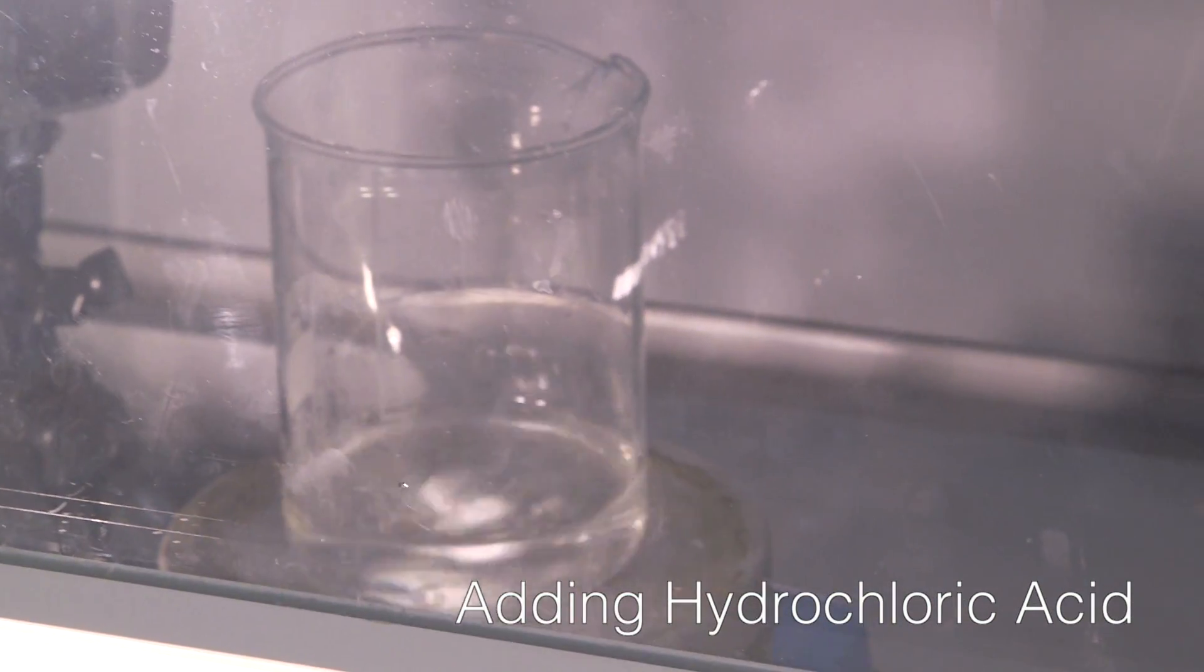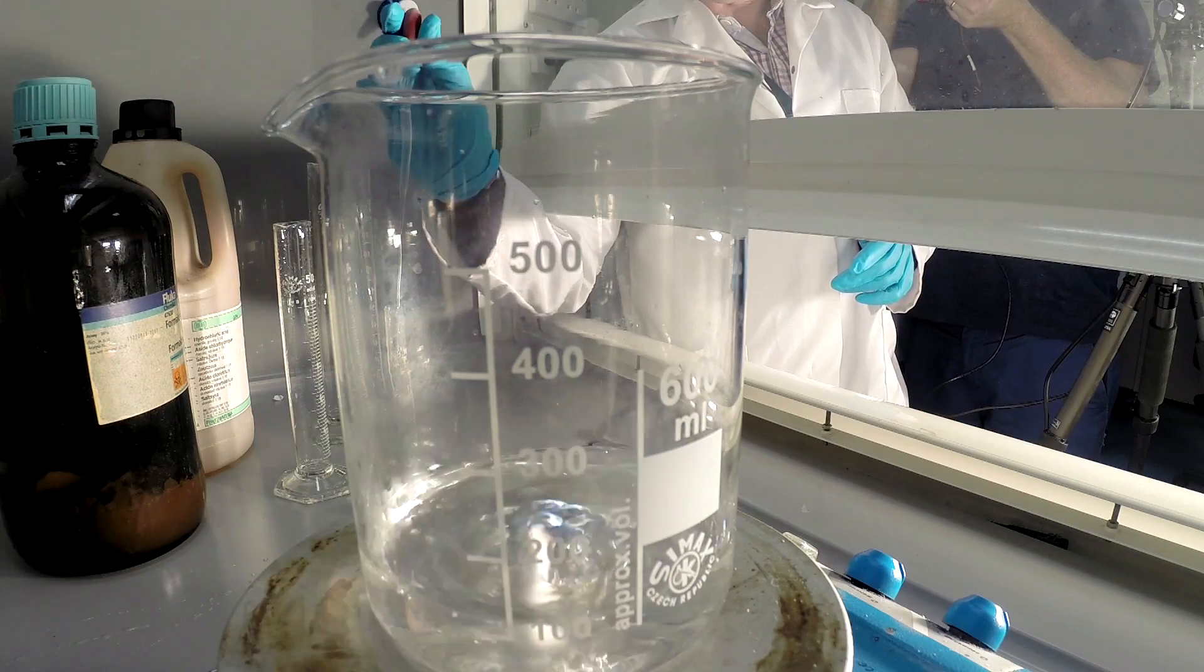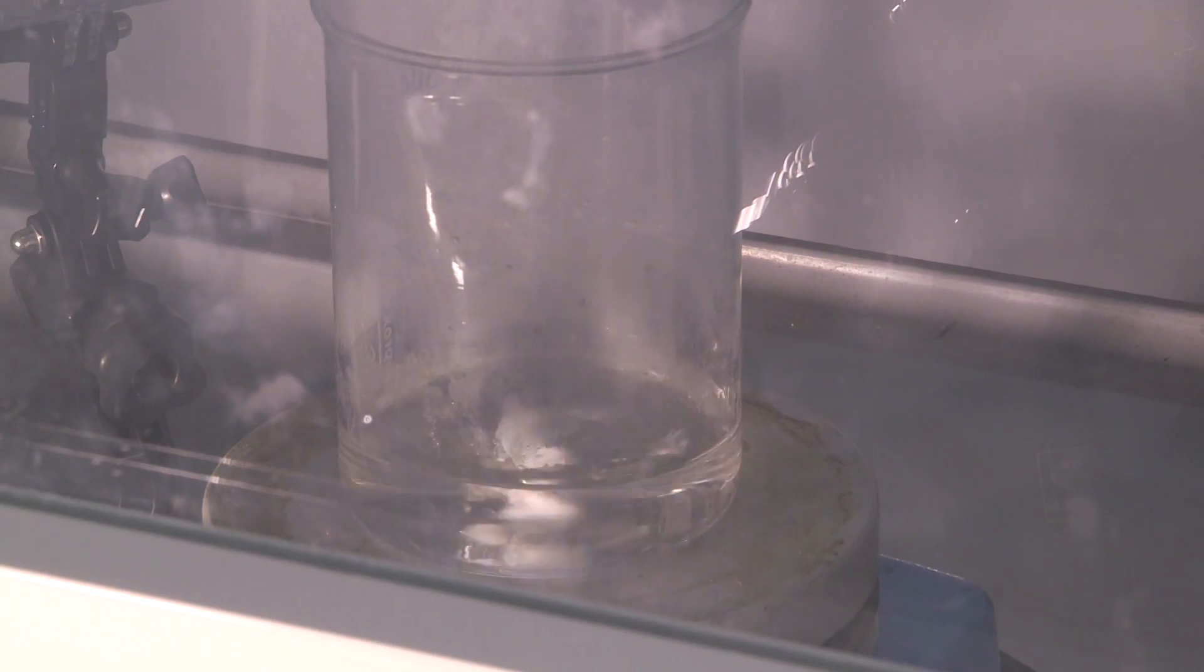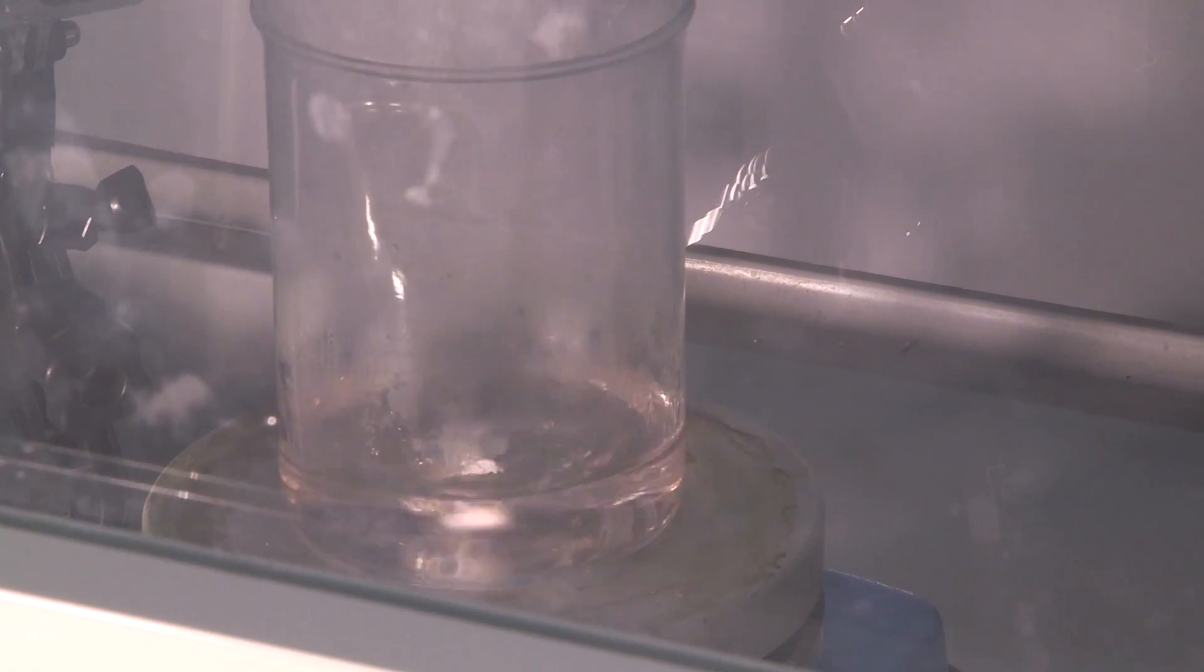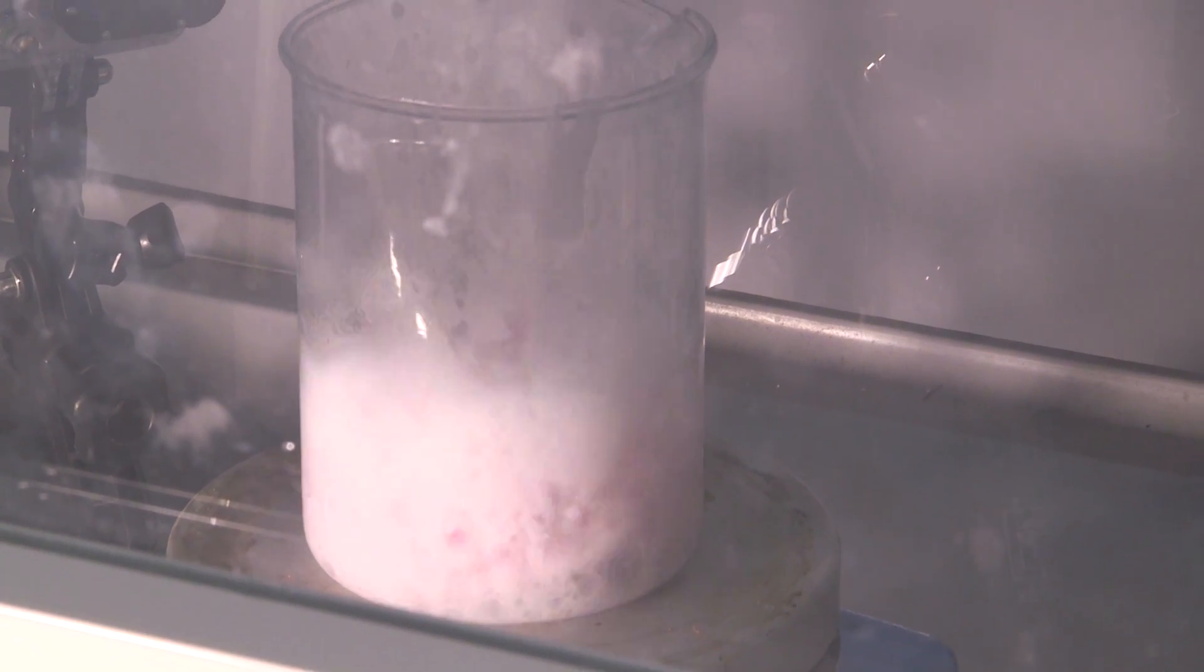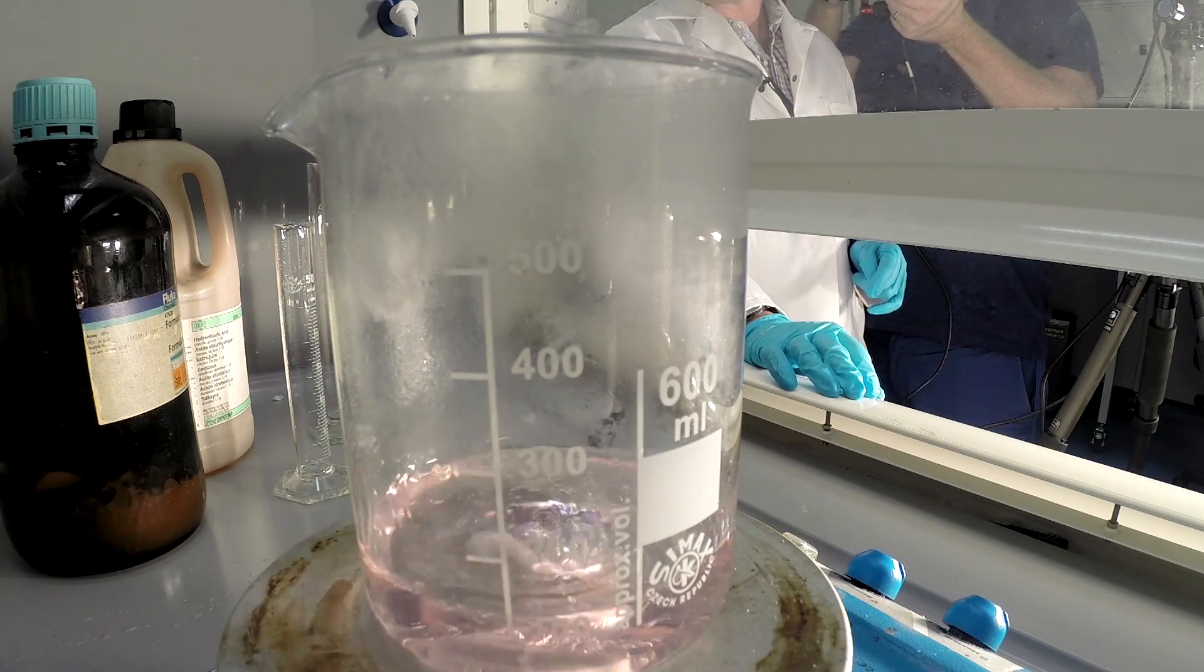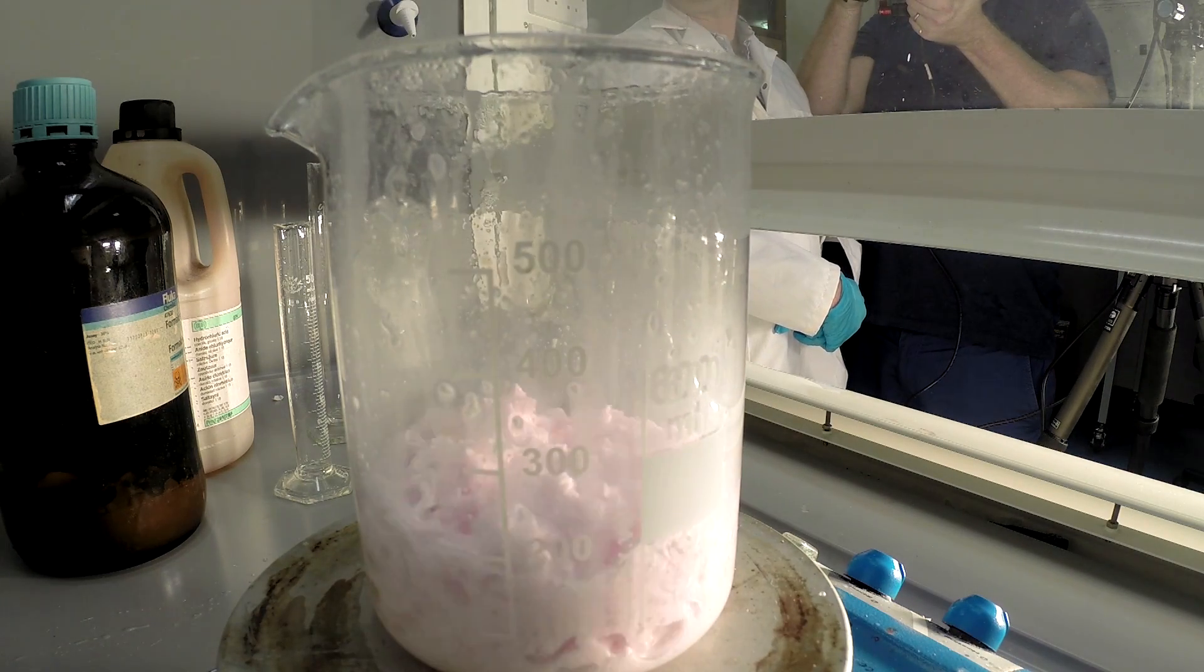So usually when we do this, nothing happens until we get to the last couple of mils. I am adding the acid quite slowly. I think we might be seeing some pink come in. There we go. We've made a plastic.